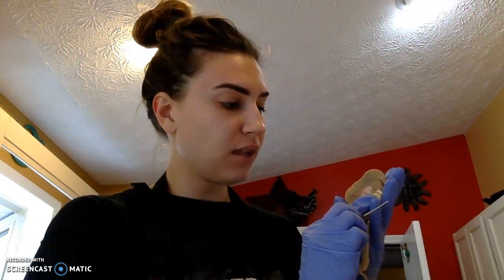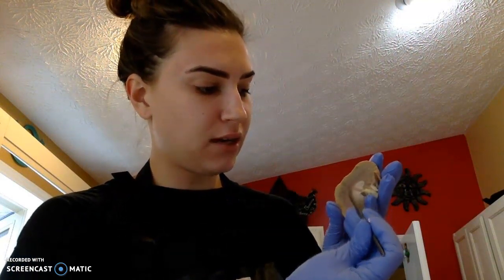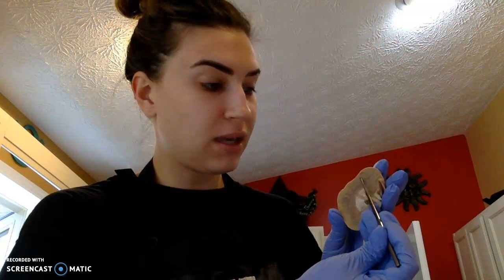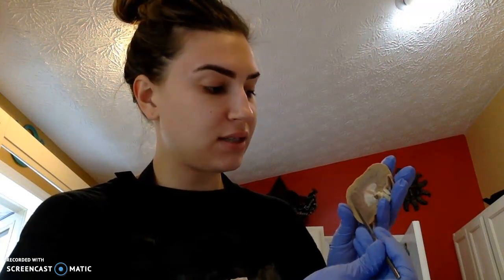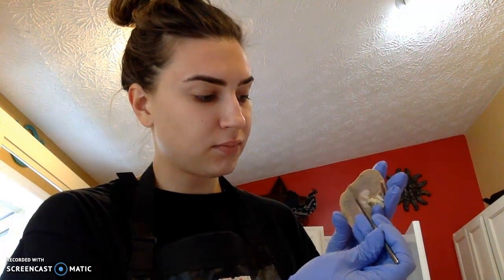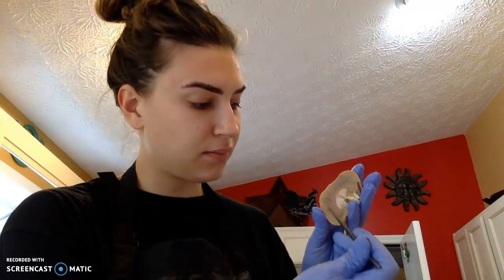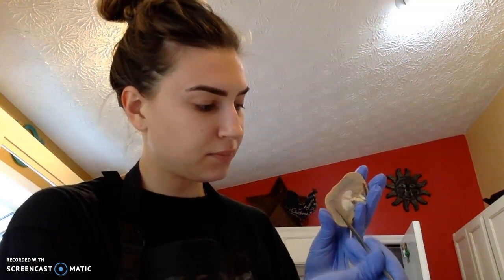So to begin the identification portion, here we have our kidney located in this portion right here. This is going to be our renal cortex. This is just deep to the renal capsule, our renal cortex. Next, just deep to the renal cortex is going to be our renal medulla portion here.